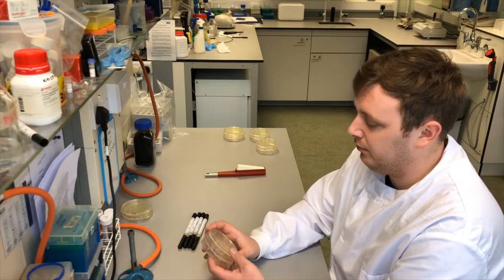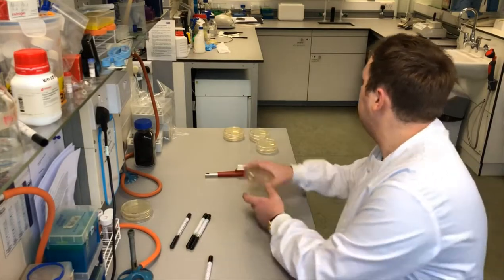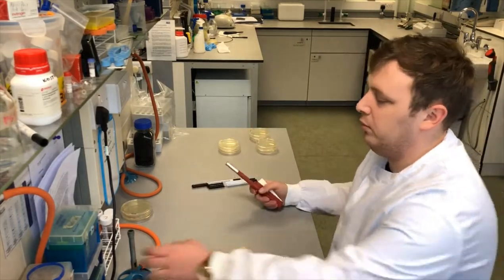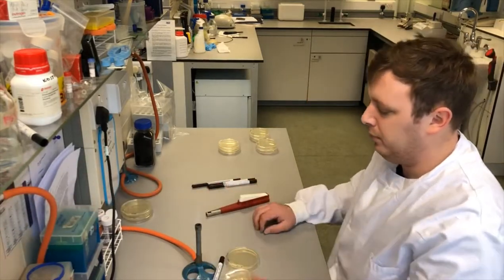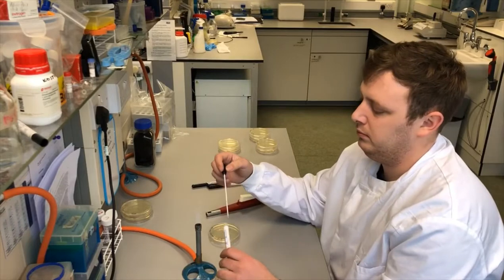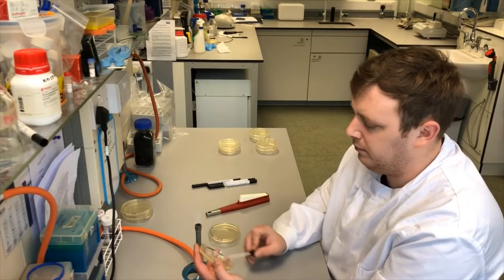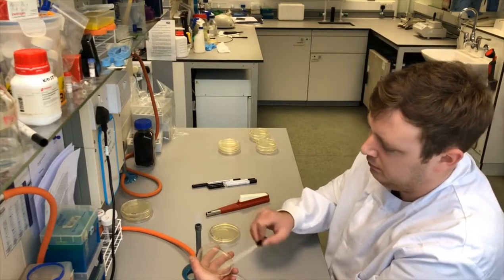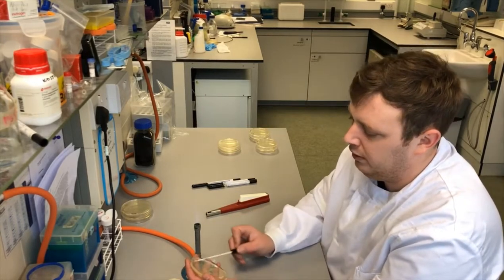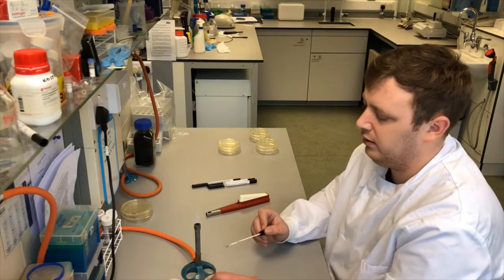To plate these out, we'll start with the main slide. I've already pre-labeled the plates — main tuning slide. We need the gas on so we're working in a sterile environment. Light the flame up, then take your swab. You can see all the gunge and rubbish on there. Then we go across the plate with it, keeping it close to the flame and as sterile as possible. We're doing both sets — this should give us a difference between environmental bacterial load and bacteria that can live inside the body.